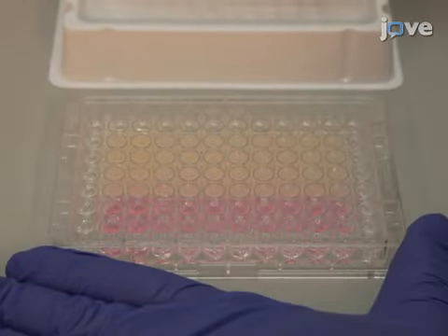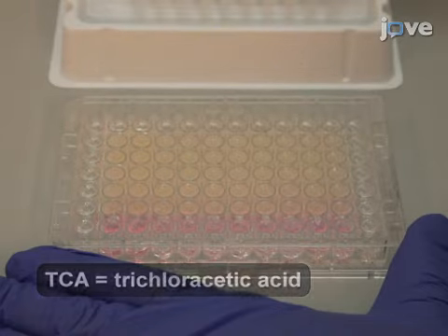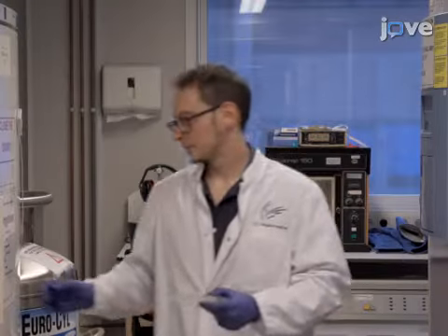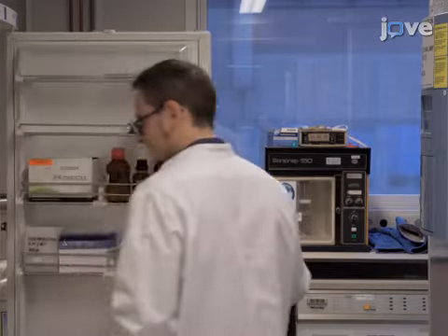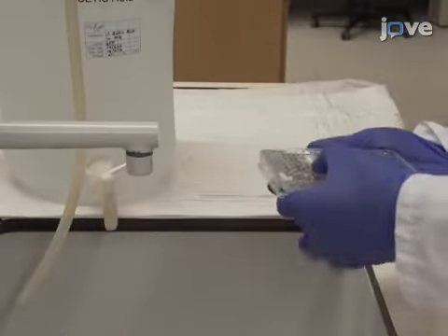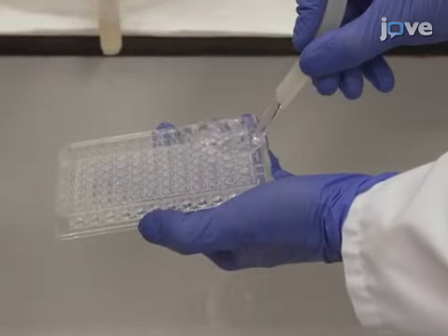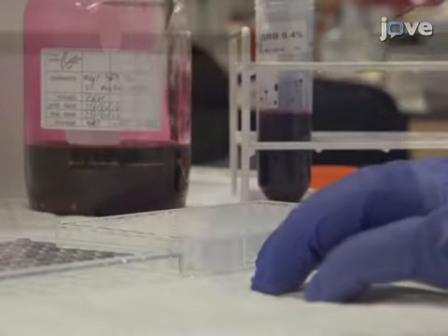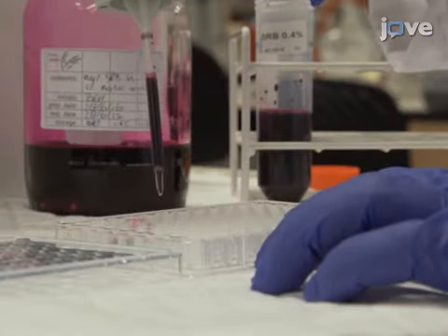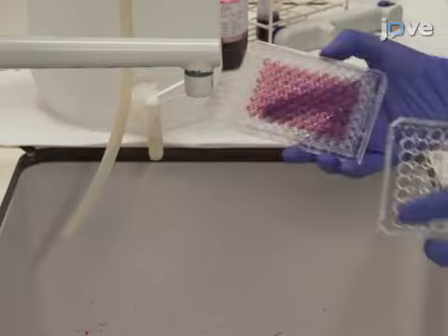Next, add 25 microliters of cold TCA solution to the wells by using a multi-channel pipette. Incubate the plates for at least 60 minutes at 4 degrees Celsius to precipitate and fix the proteins at the bottom of the wells. Empty the plate by removing the medium and dry briefly on a tissue. Wash 5 times with tap water before emptying the plate and drying at room temperature. Add 50 microliters of SRB solution per well by using a repetitive pipette, and stain for 15 minutes at room temperature. Then, empty the plate by removing the SRB stain.